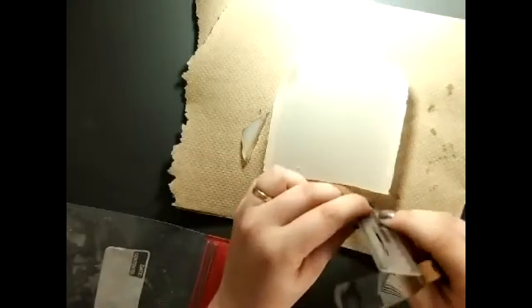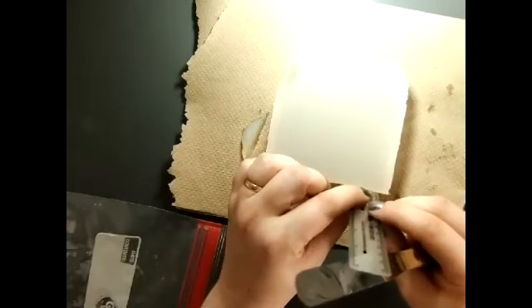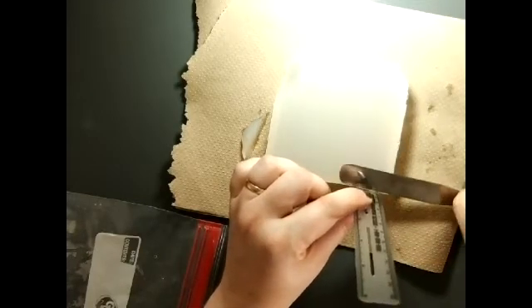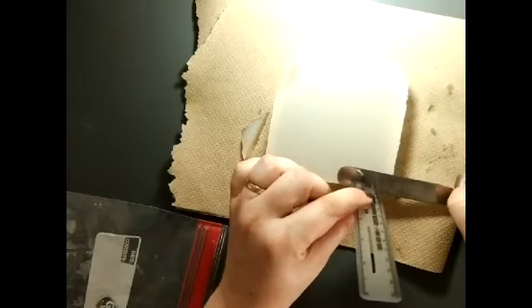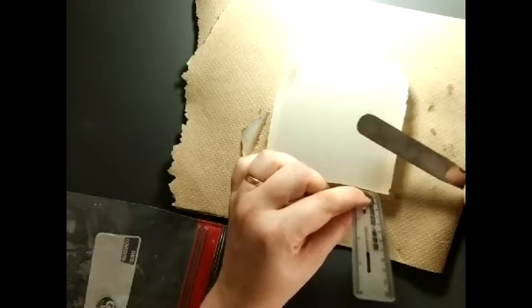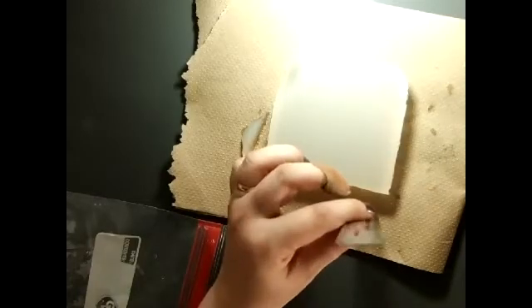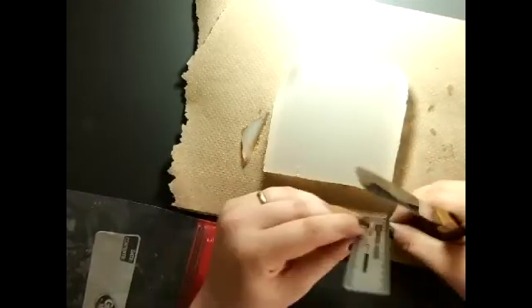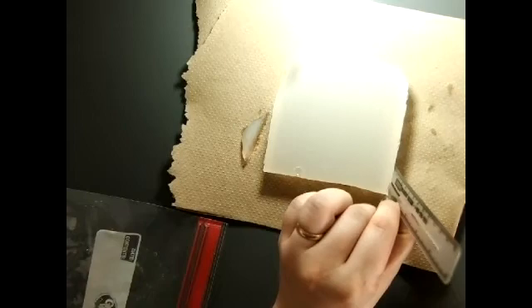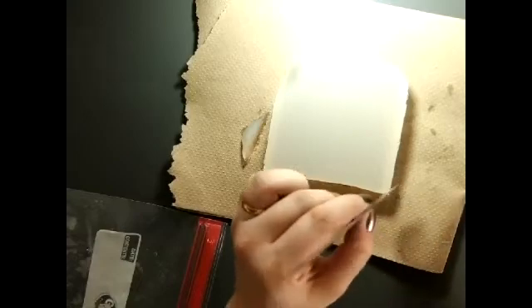And metric side goes down this way. All right, so it is only 2 centimeters deep, so I'm not going to be able to cut one that is exactly a 3 centimeter by 3 centimeter cube, but I can cut one that is 2 by 3. So that's the first one I'm going to cut here. So we have 2 on that side. Maybe 2.3 on that side.